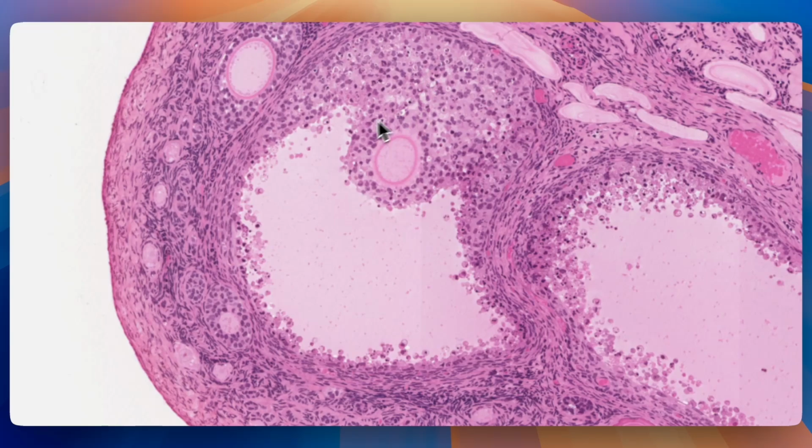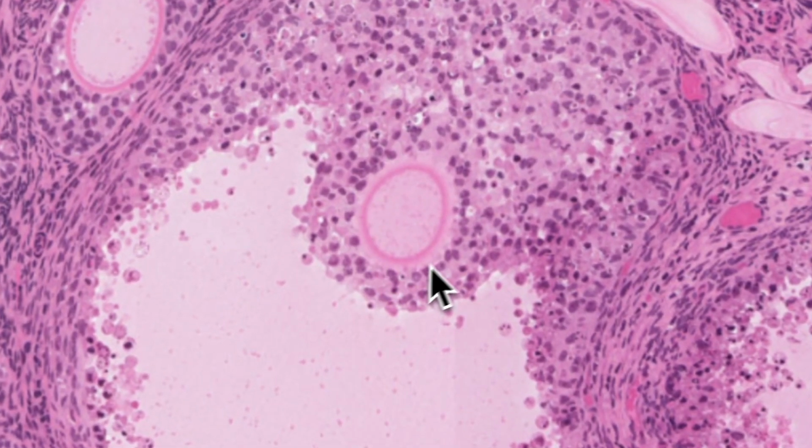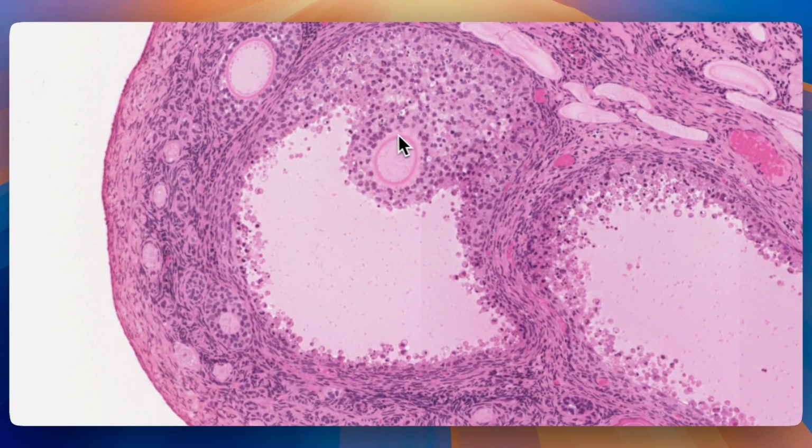That's called the cumulus oophorus. And the layer of cumulus oophorus that immediately abuts the zona pellucida is the corona radiata, okay, which means crown of cells. So during ovulation, the cumulus oophorus breaks, the ovulatory complex is released, and the corona radiata supports the oocyte and secretes signaling molecules that will guide it towards the ampulla of the uterine tube, right, which is where fertilization happens. So that is how it all comes to be. Hope that was helpful.